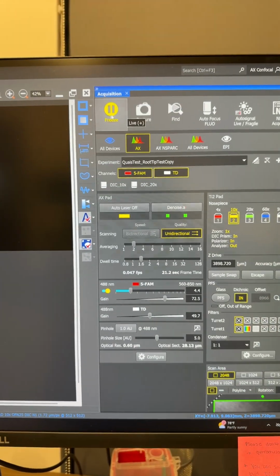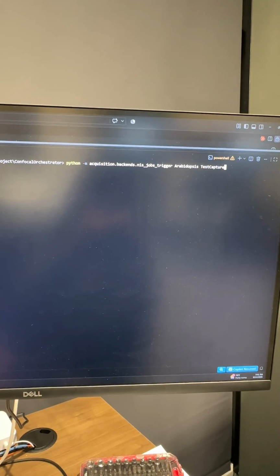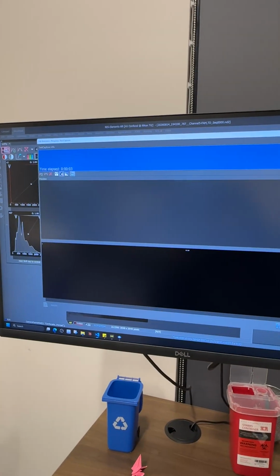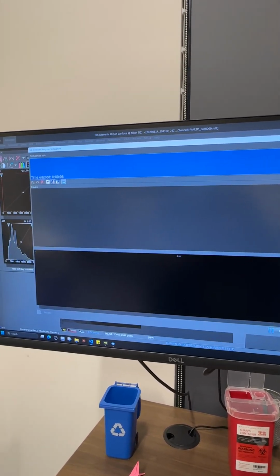Instead of clicking it from the UI, we will trigger it through our script. I'm going to run this command, which is going to talk to the microscope, and as soon as I run this command, it pops up the jobs UI for the NIS where this capture is happening automatically.